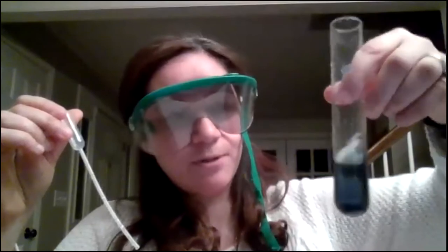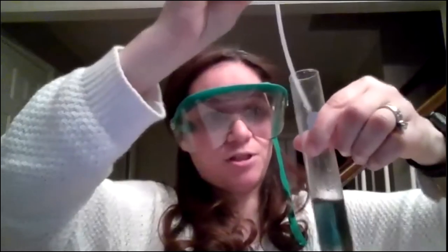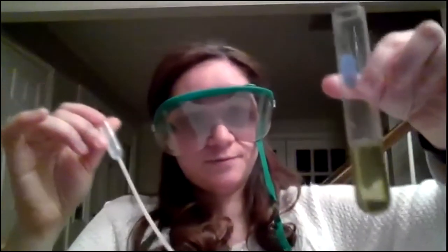And now we're seeing a tiny bit of change. It's blue after 3 full squirts. That's significant. Looks like we're reaching the buffering capacity here, and the color will change eventually. Lighter green here. Another, so this is the 5th squirt full. Kind of a yellowish color. 6, 7, 8. Looks like we're getting close to the buffering capacity here. It's orange almost.